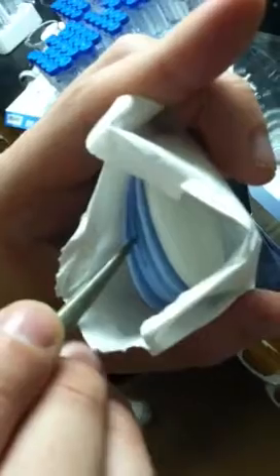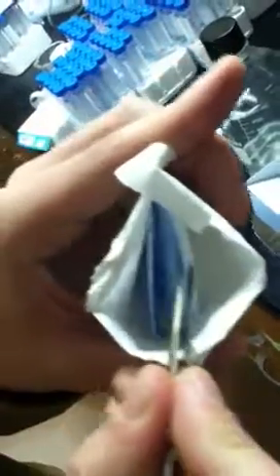Then you take the inside of this box. You should really have gloves on if you're going to be putting your hands in there. Inside of this beautiful little packet, in between the blue things — unbelievably hard to get to — there are white ones. It's like tissue paper. It'll be really easy next time. You can see one right there, really, really small. I'm not going to take it out — it's sterile in there.